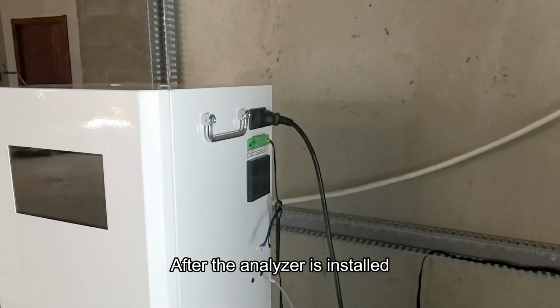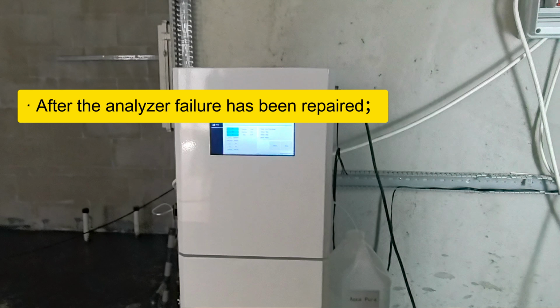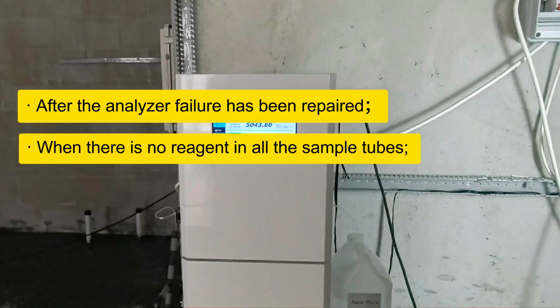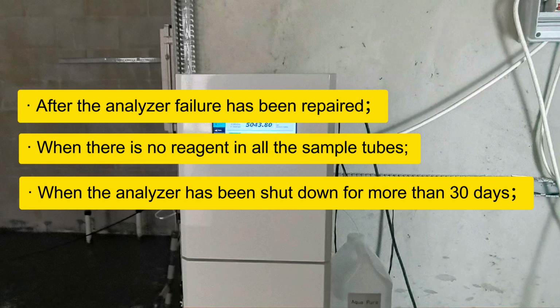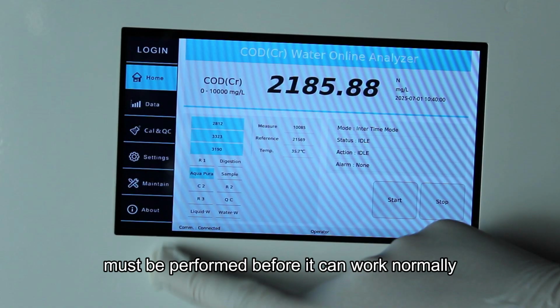After the analyzer is installed, during the first operation; after the analyzer failure has been repaired; when there is no reagent in all the sample tubes; when the analyzer has been shut down for more than 30 days, the initialization operation must be performed before it can work normally.